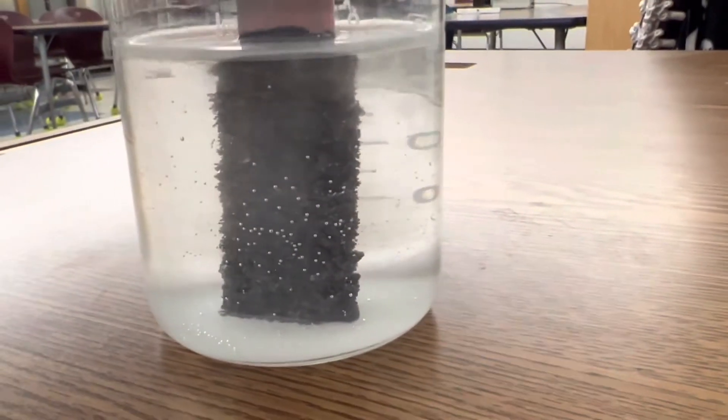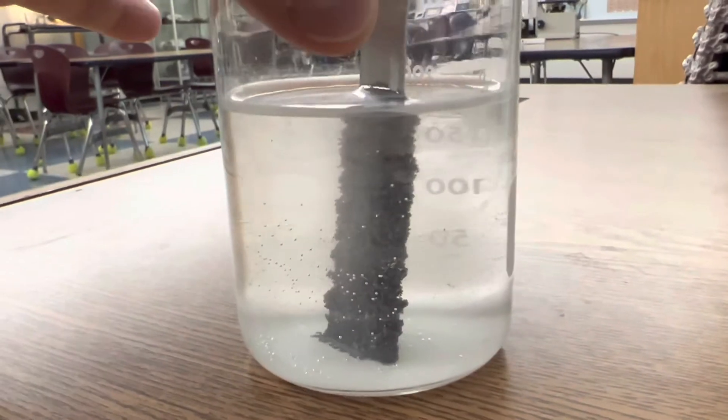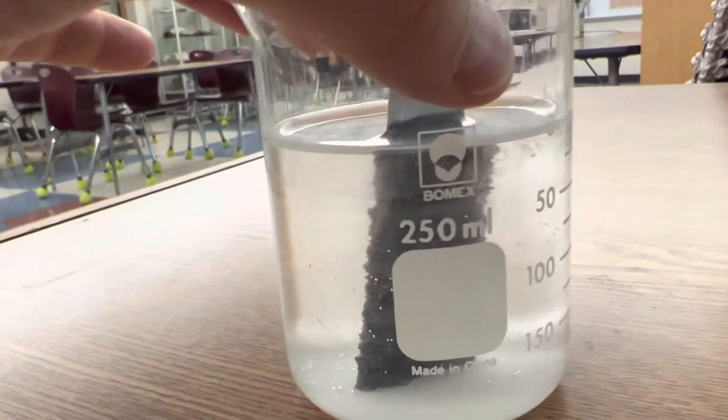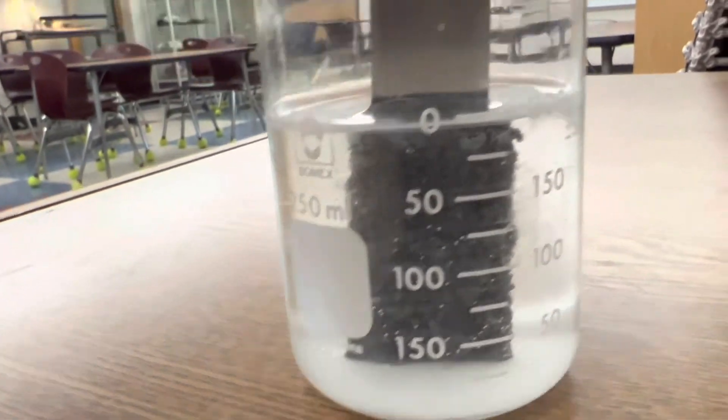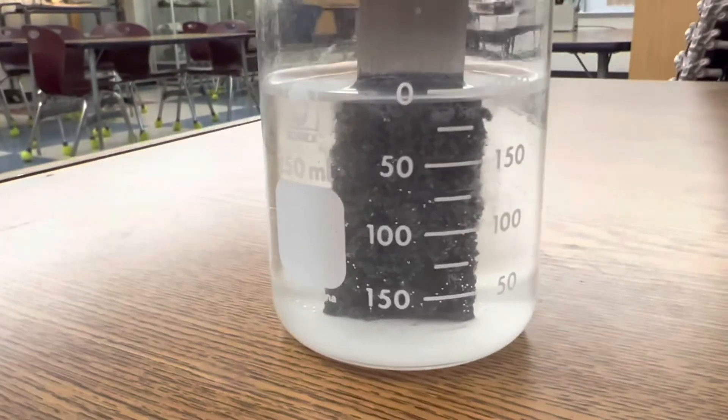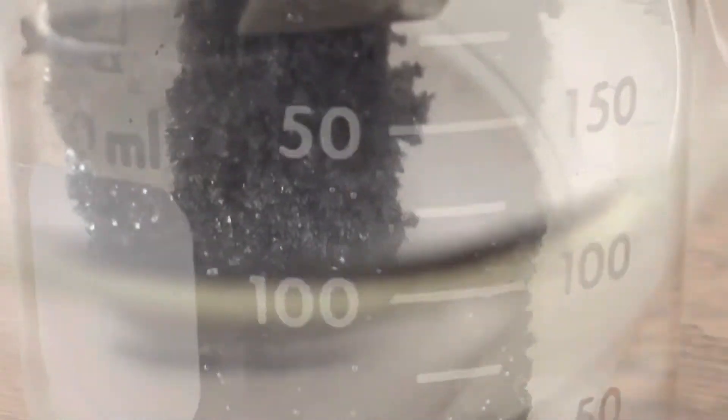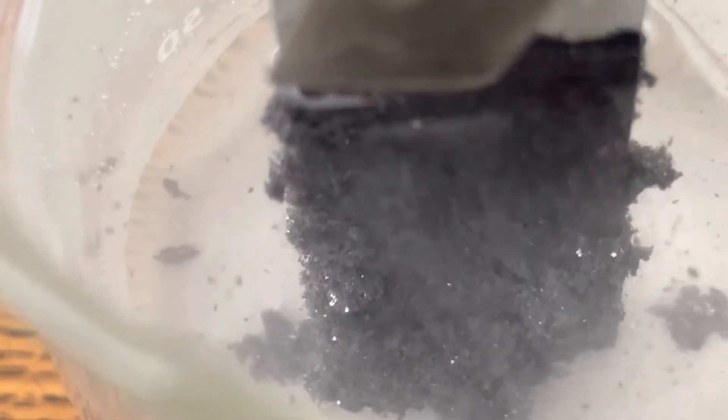Here's a side view of it. Just amazing. Here's the back. Wow. I really want to scrape off some of those lead crystals and just get a closer look. Let's try that. Oh my. Look at that. That is crazy.